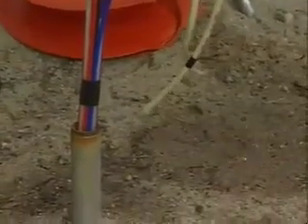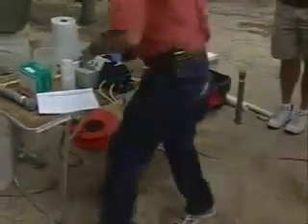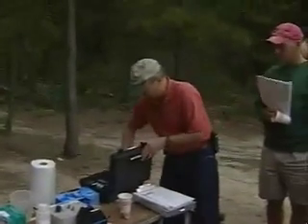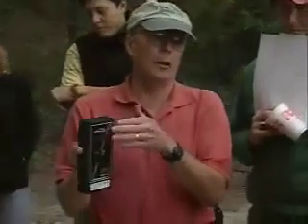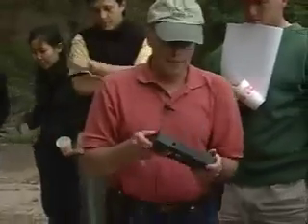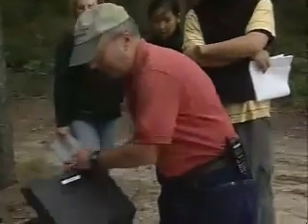Those are the two ports that are pumping right now. We do a lot of field kit analysis — using a colorimetric field kit with a spectrophotometer that uses the color from the reaction to give you a concentration measurement right in the field. I'm not going to bother doing this right now because the sites I picked are pretty obvious.